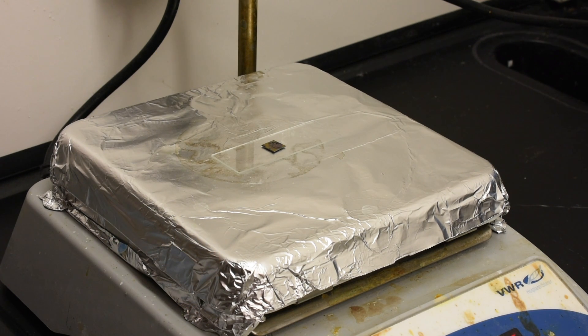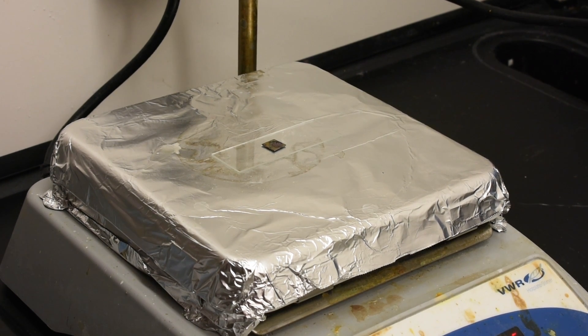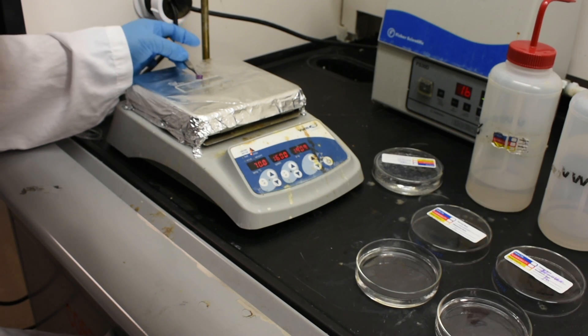Finally, we are ready to remove the PMMA, leaving our thin film on a final substrate. To dissolve the PMMA, the sample is put into an acetone bath, typically for one to two hours.